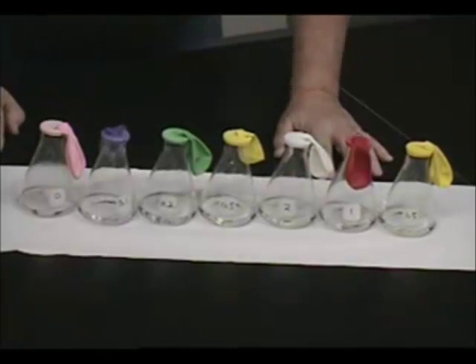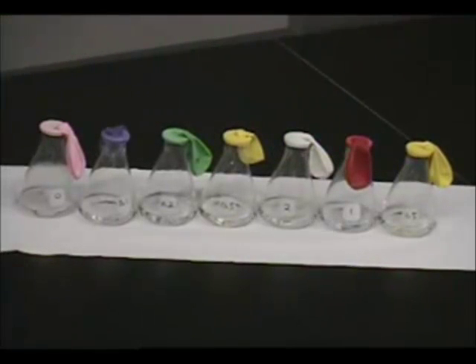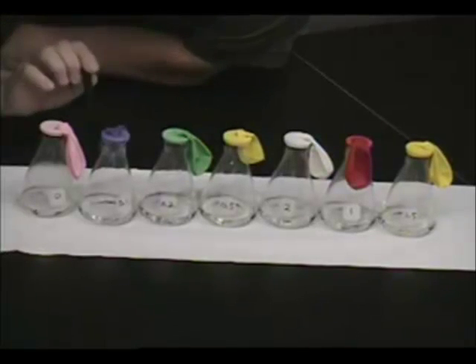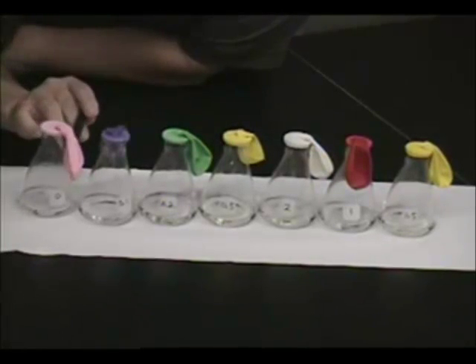Let me tell you what the experiment is. You saw me lining up all this stuff. This is pretty cool, because we get to actually see a reaction go here.